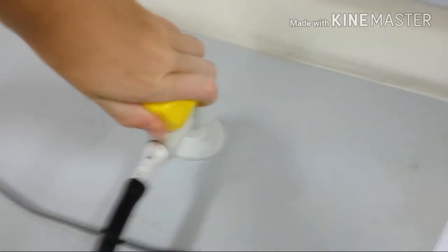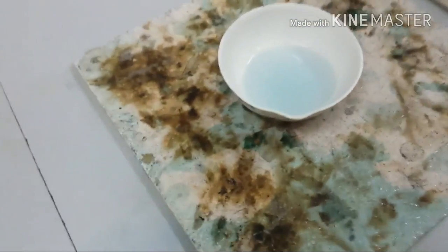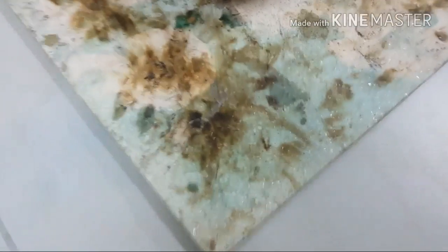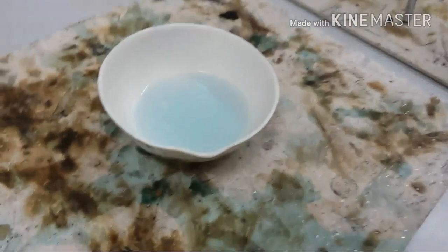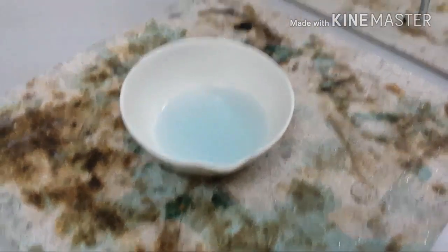Okay guys, turn it off. Turn off the fire. There we go, the fire's off. And then now, it's not meant to be like this, but okay. It's meant to be fully evaporated with the salt right behind. But it's okay.